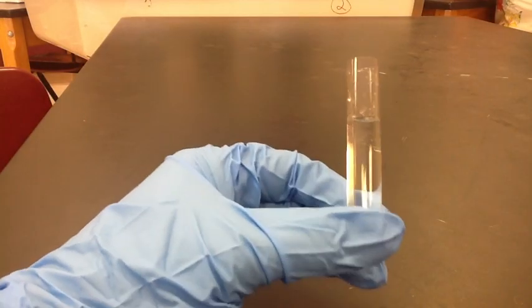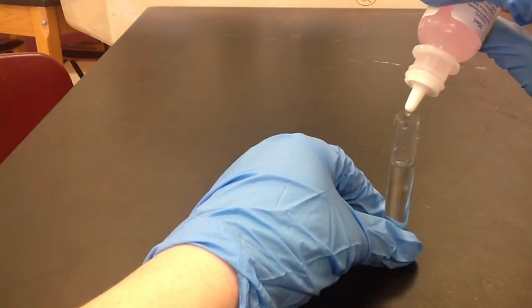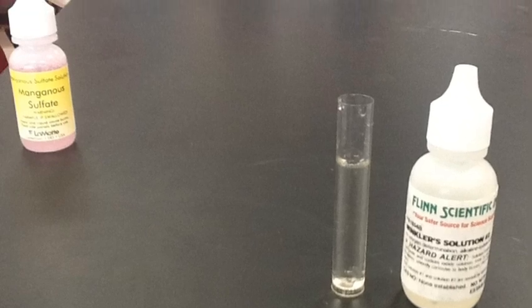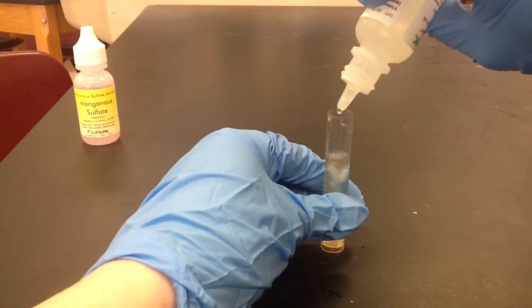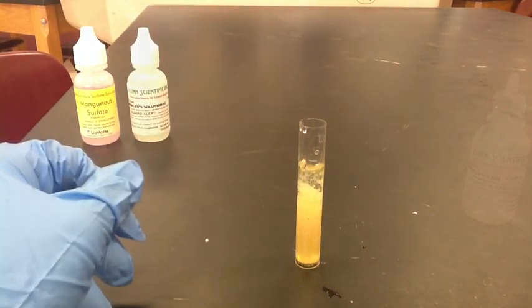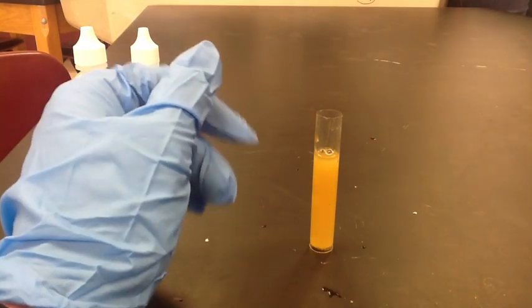The first step was to fill the tube with the lake water. Now I'm adding eight drops of this solution, then eight drops of alkaline potassium iodide, which did create some precipitate. Next I will cap and mix, which makes the water very murky and you cannot see through it.